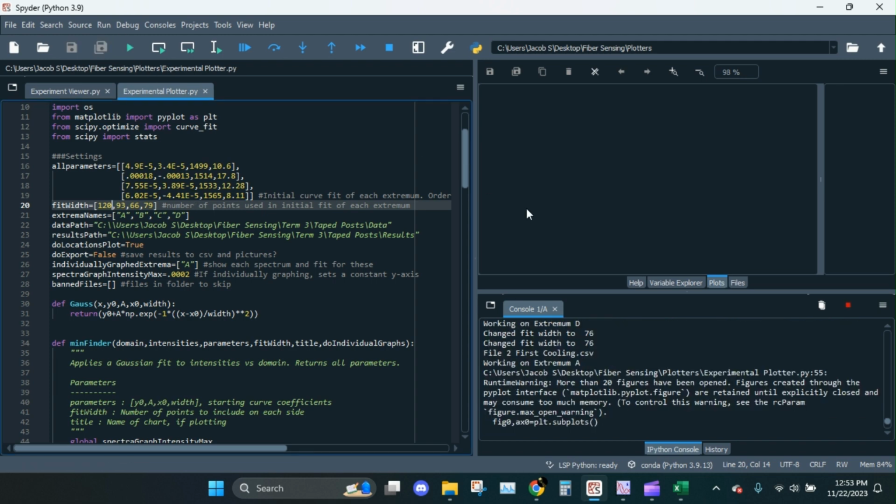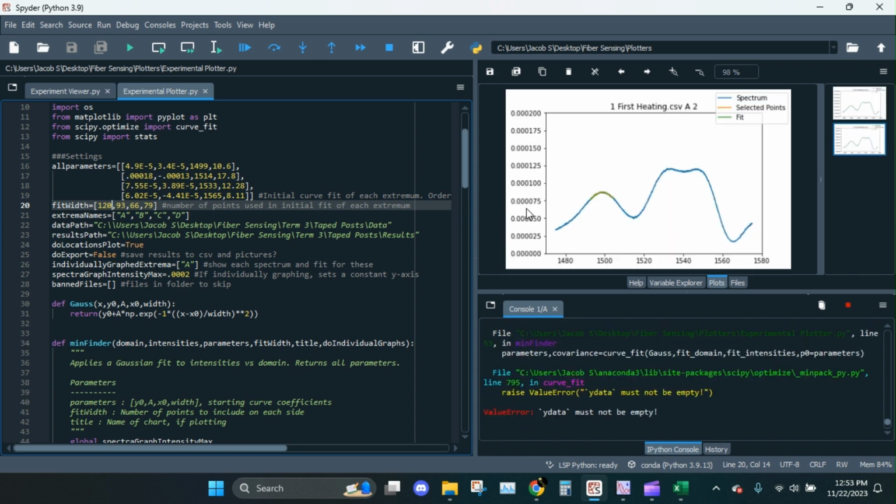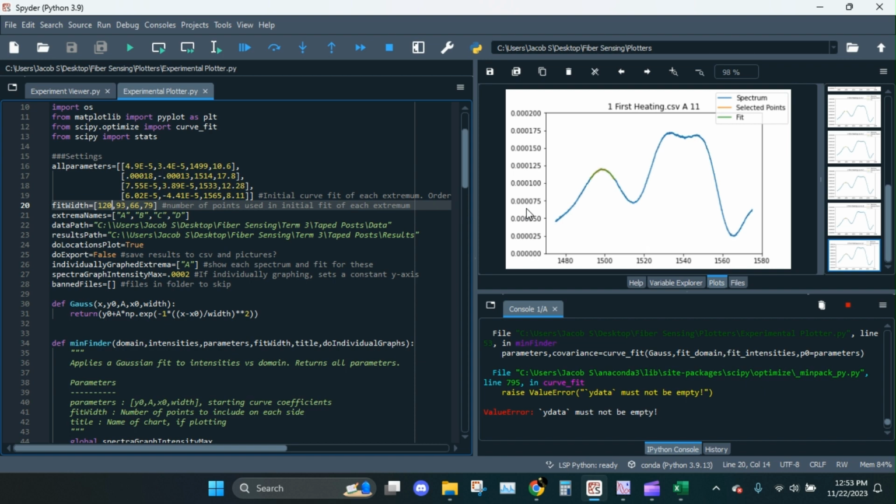Oh, it's going. All right, so we didn't get all the way through this time, but oh, look, it's generating graphs. Yeah, I'm gonna have to change that y-axis thing.